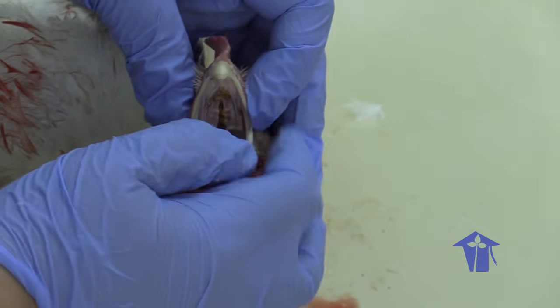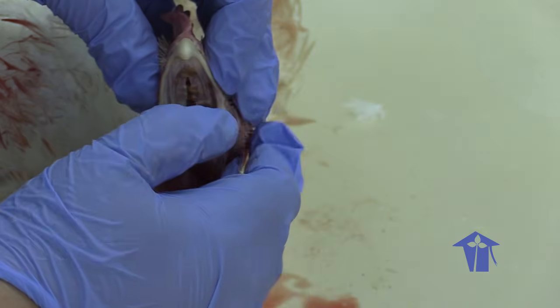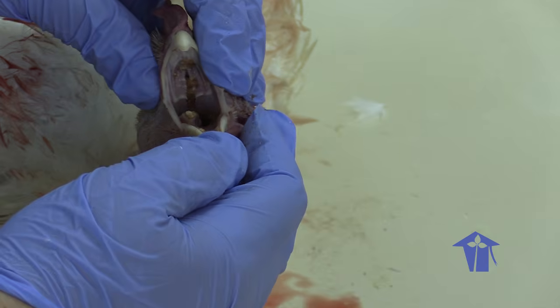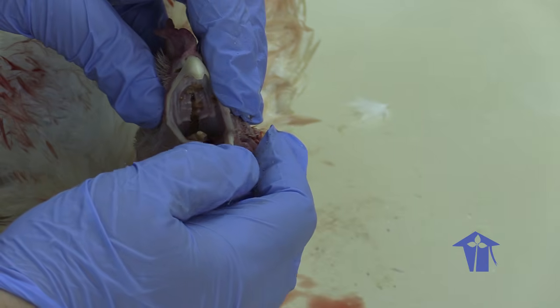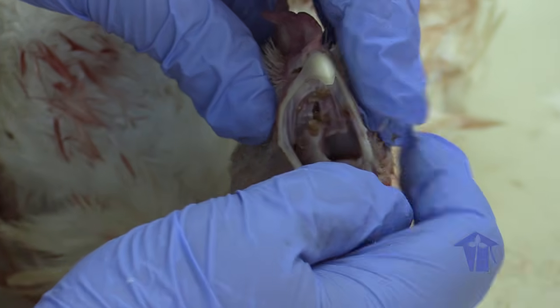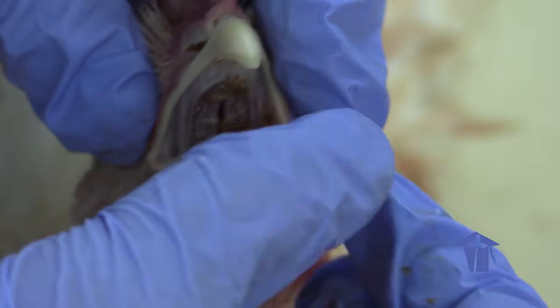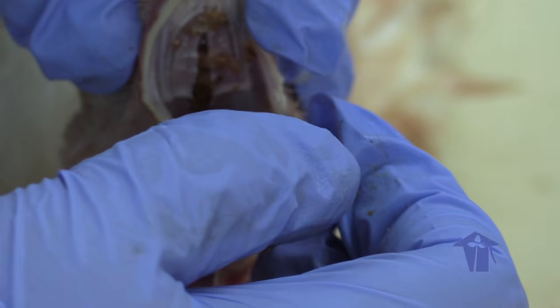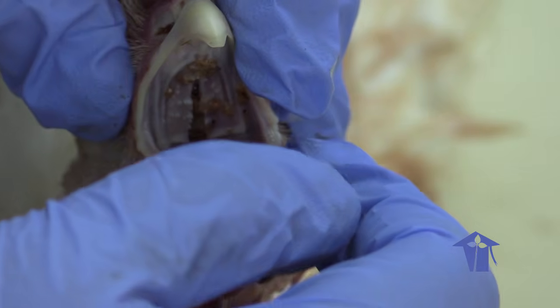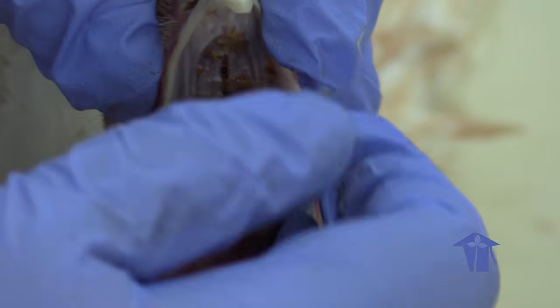So the digestive system, the mouth, leads to, what does the mouth lead to? Leads to the esophagus, right? Because this is freshly killed, we're still seeing a little bit of regurgitated food material here. The tongue is a hardish structure. It's more for manipulation of the food backwards into the gullet, as opposed to a tasting and mixing organ like we see with our teeth and our mouths, right?